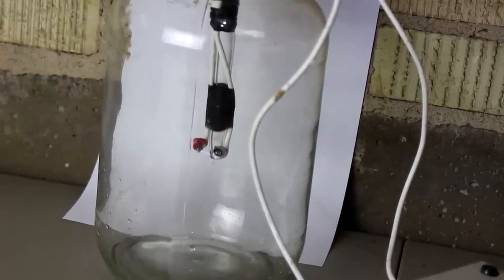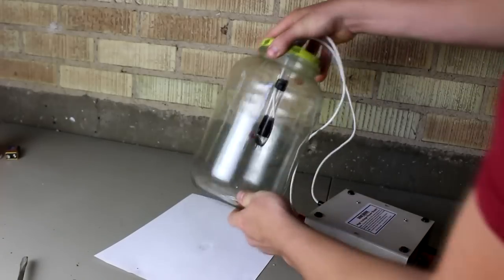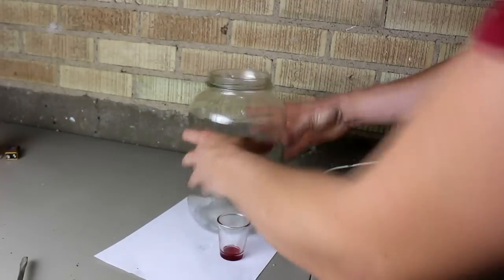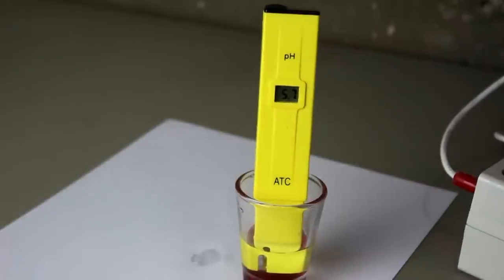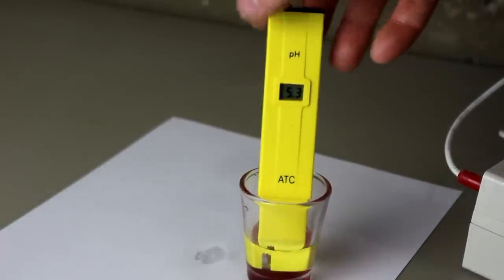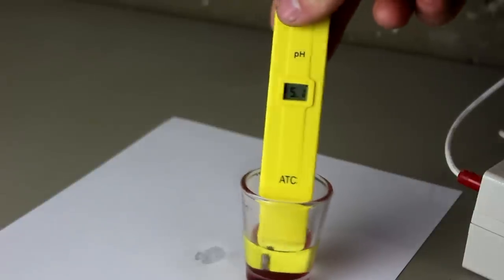It's been going for a few minutes — let's turn this off and mix the water in with the gas that's in the jar. You can see it's got a slight brown tint to it. Let's open this up and pour the water into the shot glass to check the pH. It reads 5.7, just after a couple of minutes of running. It's going to produce quite a lot of nitric acid but it's going to take a while. We can do it this way though.